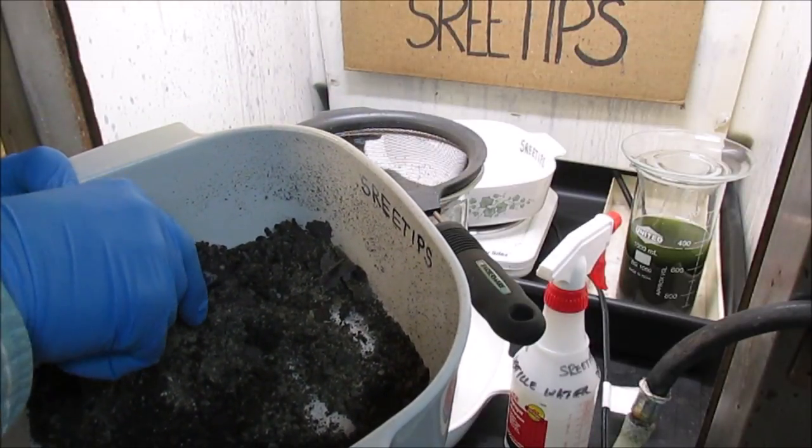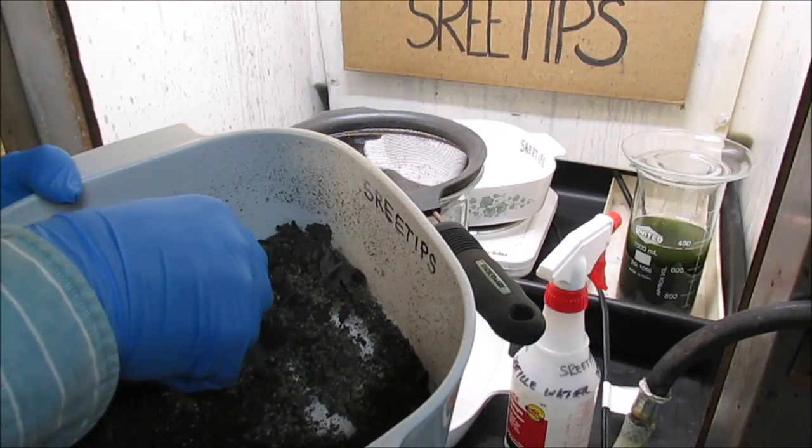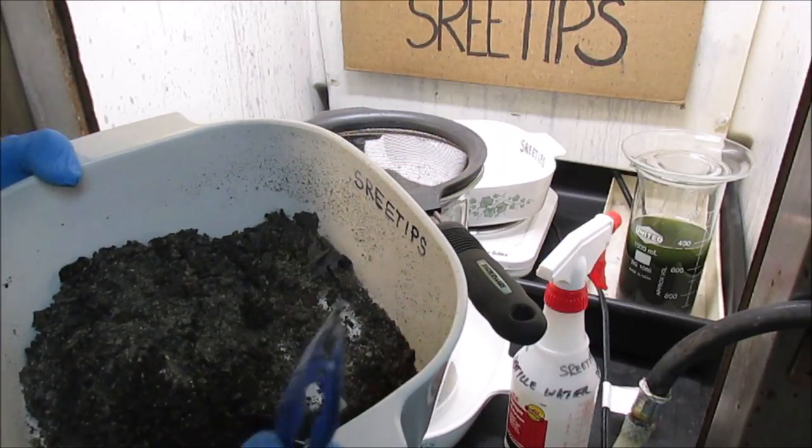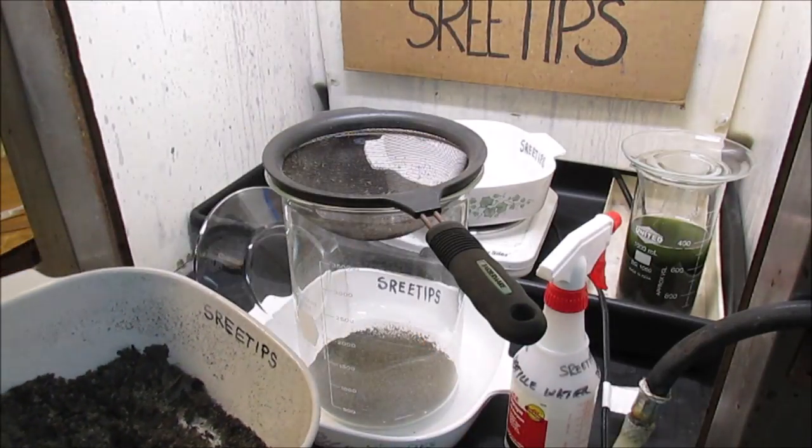I thought I'd seen a little piece of metal over here. There's like a little piece of aluminum there, so I picked that out and got rid of it.